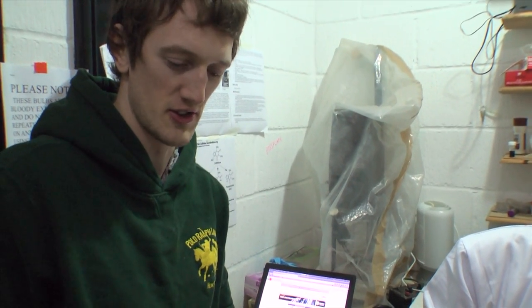We put the samples in the centrifuge to get the solid cheek matter down to the bottom of the tube and then we can throw away the water. These are old vintage centrifuges that we're very proud of.